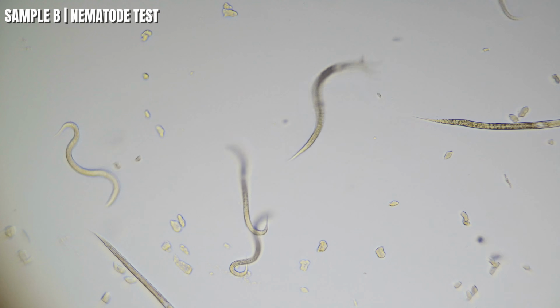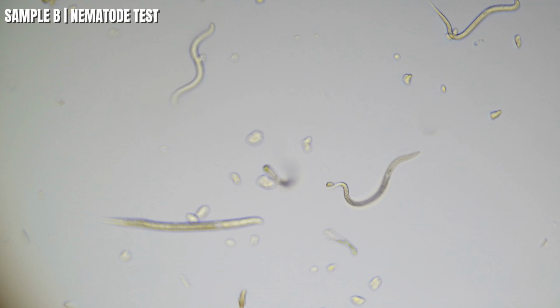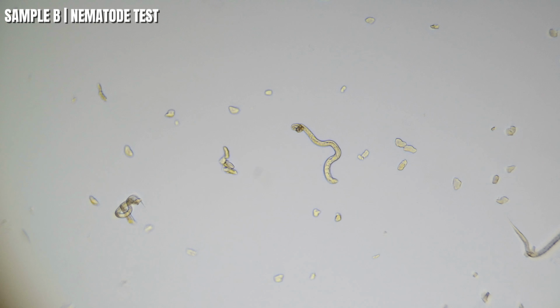So I zoomed in a little bit and yeah, they slowed up big time. You can tell they're not moving around quite as much. And as I watch them, it only takes a few minutes. So, okay, I think we're ready for sample C. You guys ready? Let's do this.